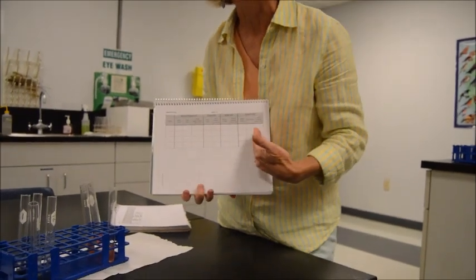Okay. So now that we have concluded the testing of the 2 unknown food samples, and you should be writing results in your lab book, as we explained in the beginning, we have given you the consistency and the smell. Based on what's present and what's absent as far as our organic compounds, what do you think is in our unknown solutions? What do you think they're made of? We're not going to tell you today. As you fill in your lab report that you're going to be turning in, we want you to give us that answer, and just for fun, we'll see if you're right or not, and we'll be happy to share it at that point in time.